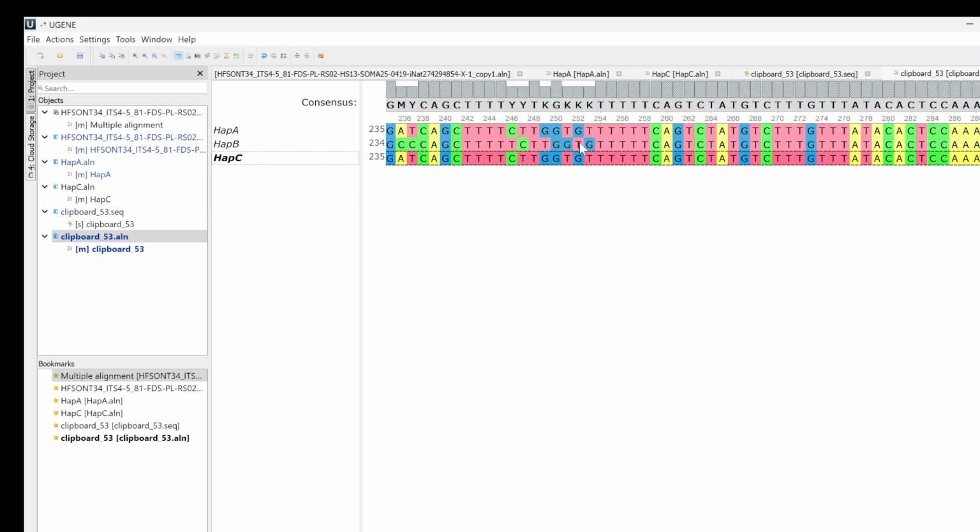Really what happened here is you have something missing relative to one of the other sequences. So it looks like this T is extra in haplotype B. It's missing from haplotype A and haplotype C. So the actual consensus wouldn't be Y, Y, T, K, G, K, K, K. This would be moved over. And your consensus sequence would just have 5 T's in it. It would be 5 T's and then C, T, T, G, G, T, G. So it would look like this one.